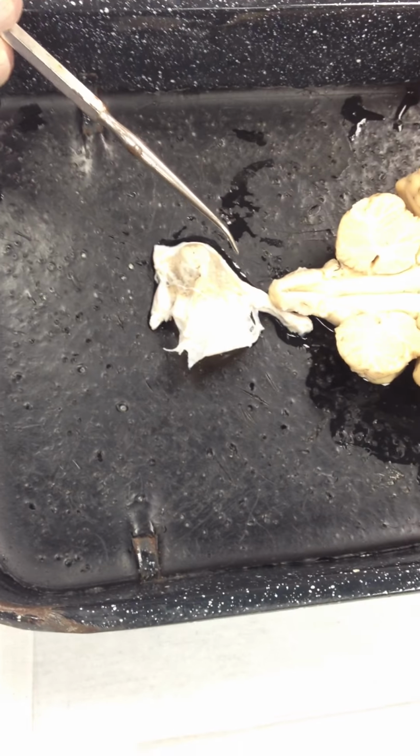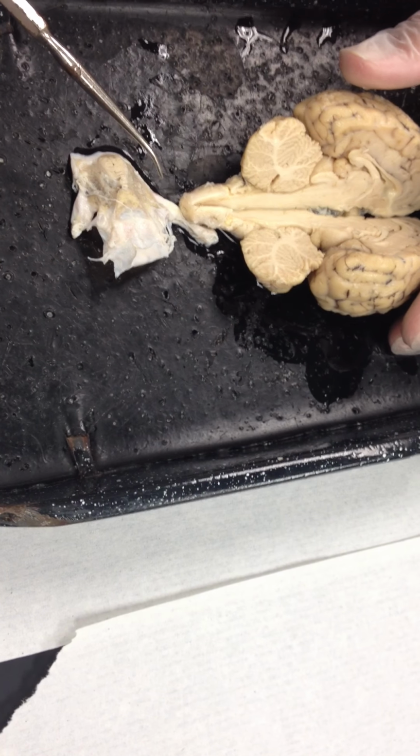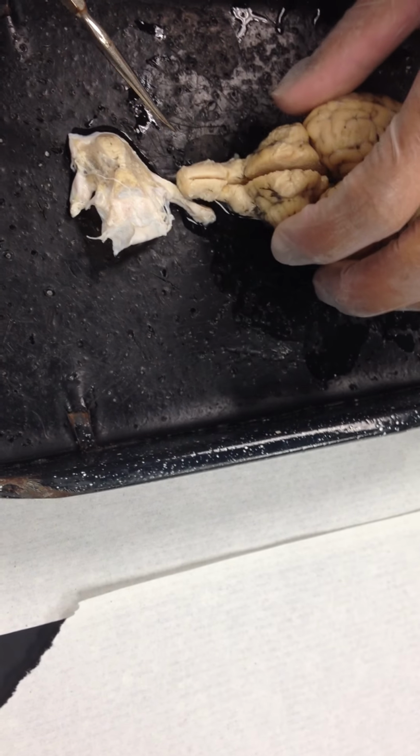Okay, so that we can get down and look at those cranial nerves. If you haven't done that already, then you'll need to do that, but you'll need to be very careful in the way that you remove this membrane. Now, what you're gonna notice, guys, are the small white fibers you can possibly see on this brain. For example, right here, and right here, there's the stuff that holds that membrane together. This happens to be cranial nerve pair number 6.